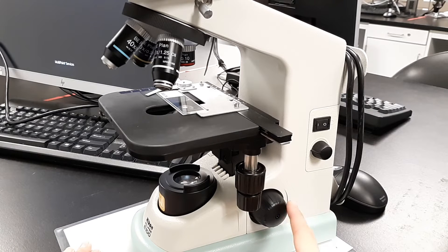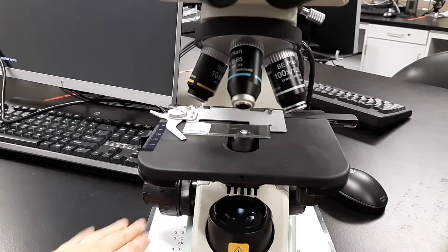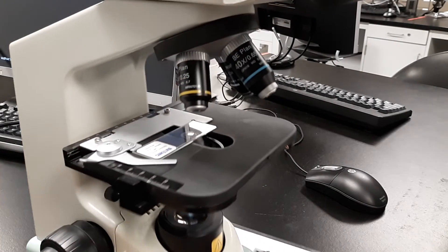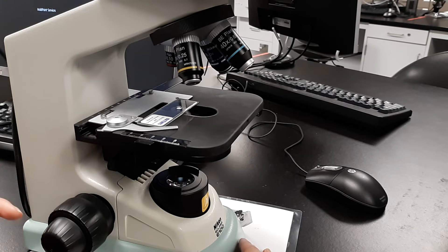Remember you have the fine focus right here—this takes the blur out. You have your coarse focus, which is this large knob down here, and then your fine focus.